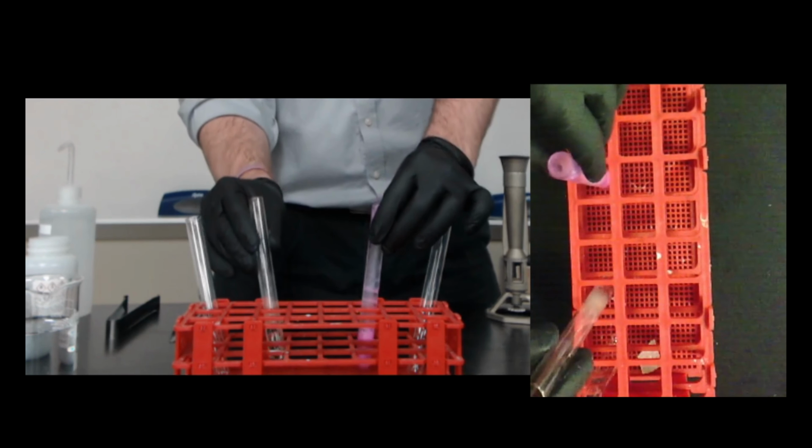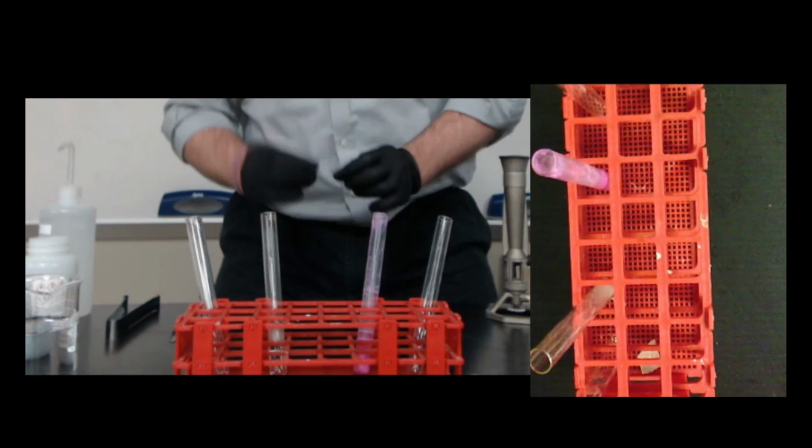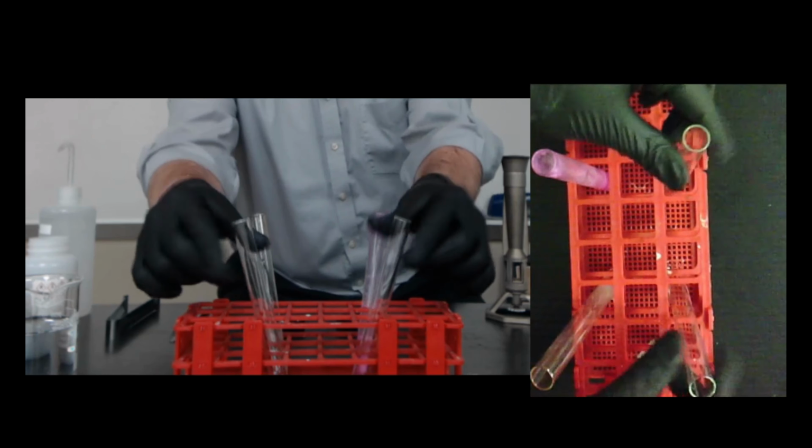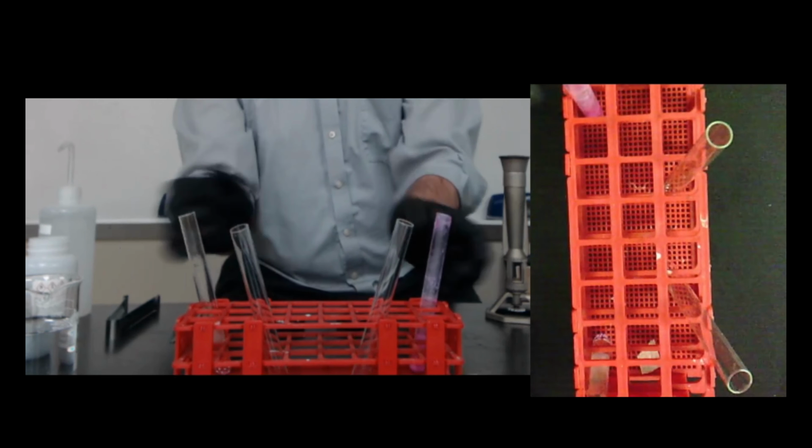Okay, that's our first part. Now go ahead and pause the video, answer the questions that you have there, and then we can move on to the second part where we look at the reaction with acid.